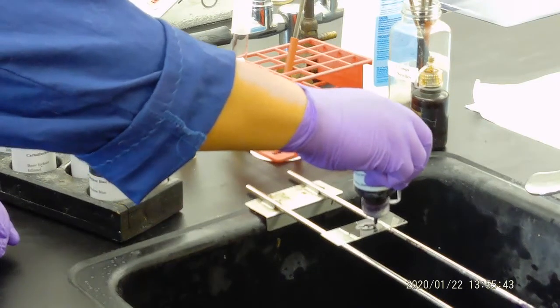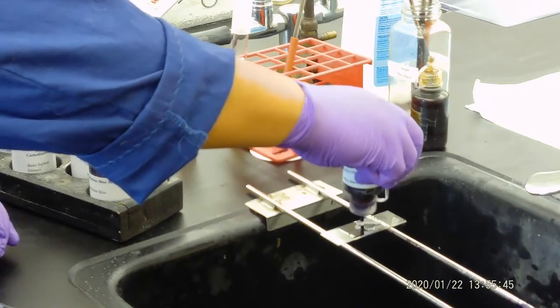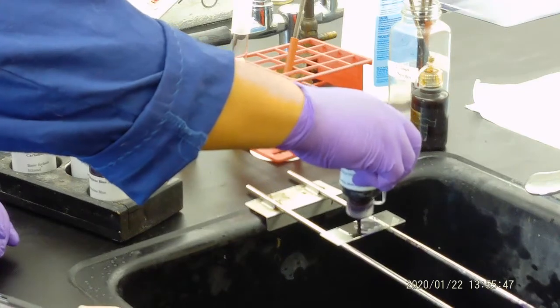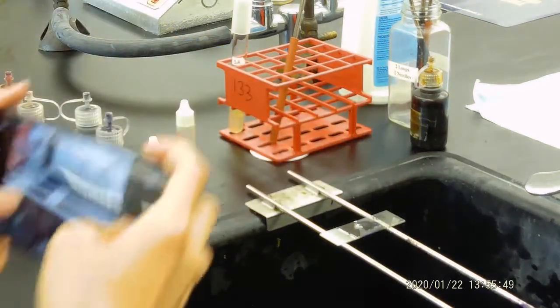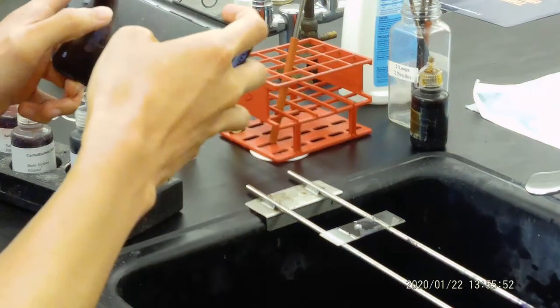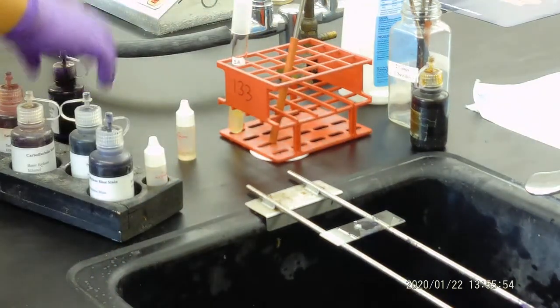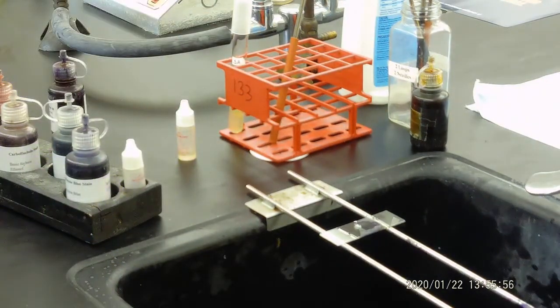Usually we will be staining about one minute. So we stain about one minute. Let's say the one minute is ready.